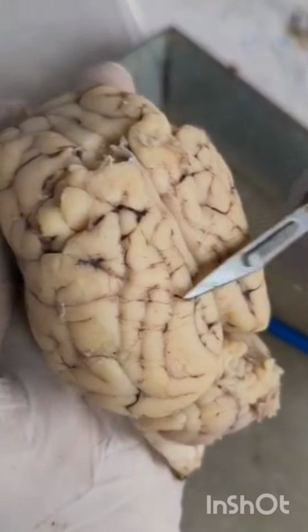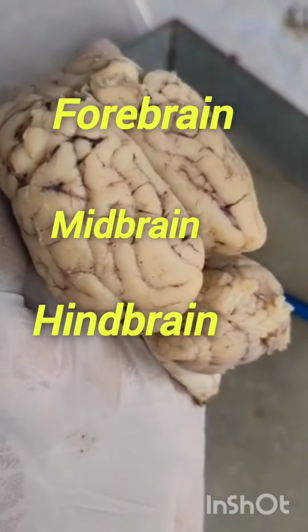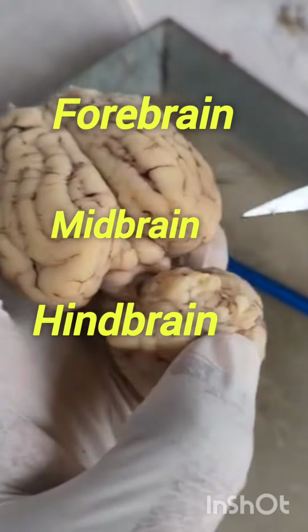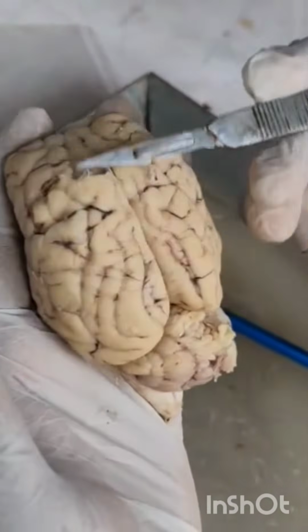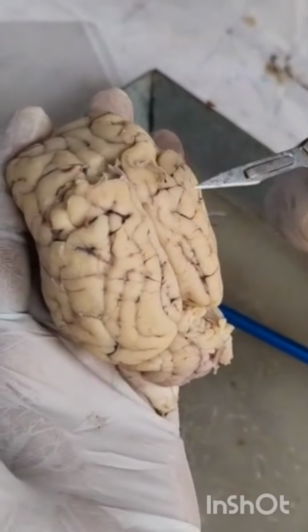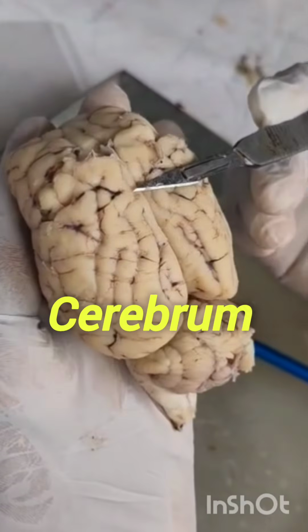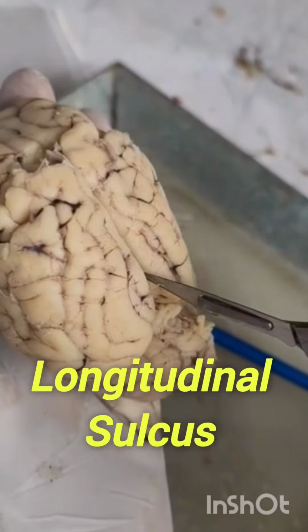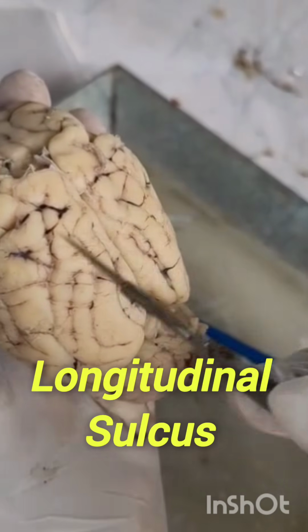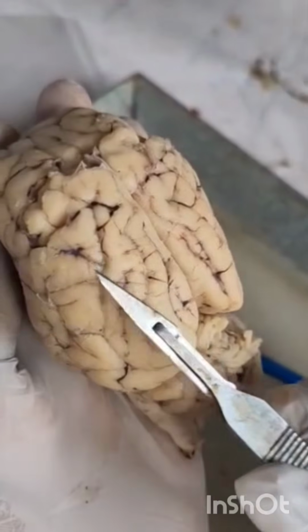We know the brain is divided into three divisions: forebrain, midbrain, and hindbrain. This is the midbrain, and this is the hindbrain. The forebrain has the cerebrum. The cerebrum is a major portion of the forebrain. The cerebrum is divided into two equal halves by a longitudinal sulcus, into left cerebral hemisphere and right cerebral hemisphere.